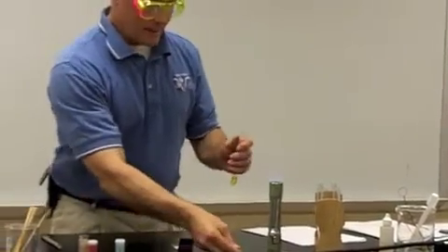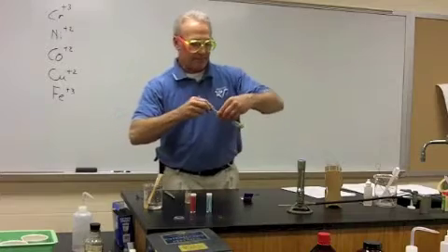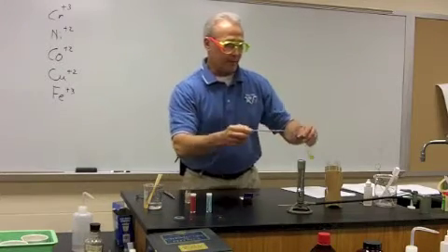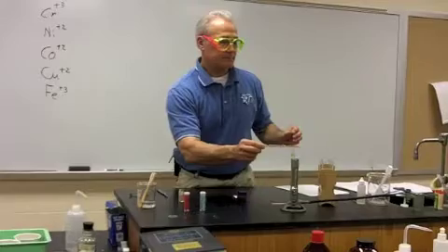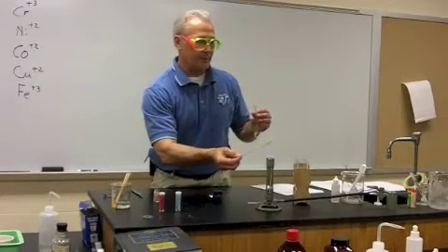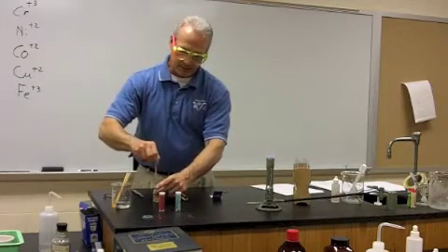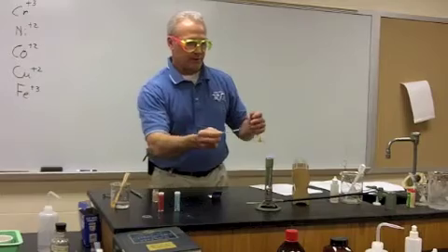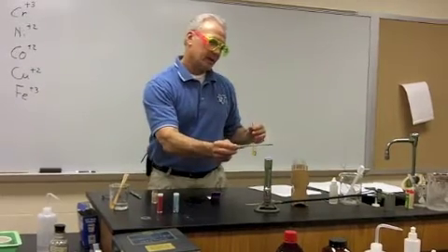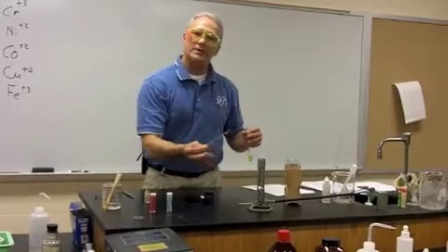Okay, and we can try this. You can do this test over and over, and I'll try it again with just liquid on there and see if anything happens, because sometimes just the liquid alone will give us a flame color. Again, nothing happens with that, and I'll try it again and just stick it right in there to see if any crystals stick to that, and we'll insert it in again. We can see there's no characteristic flame other than a pale yellow. I'll give you a moment to jot that down.